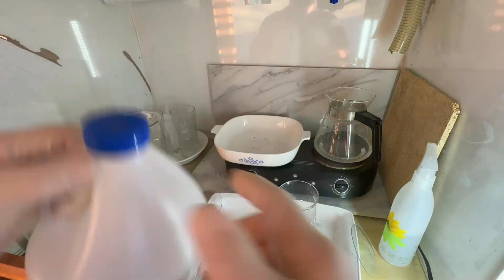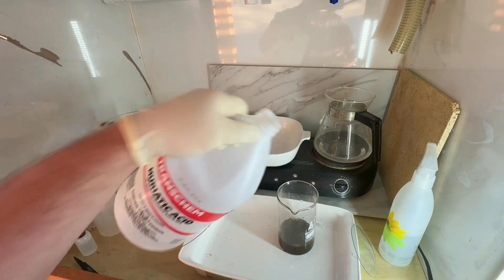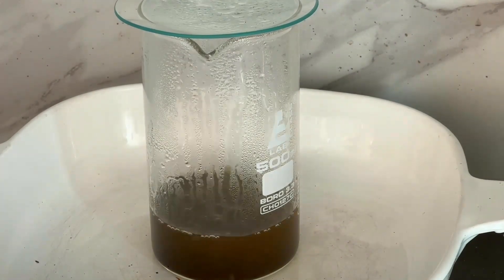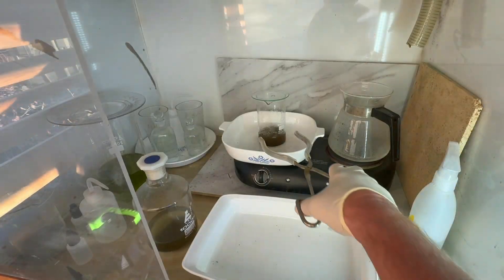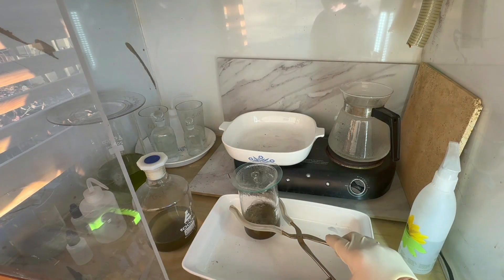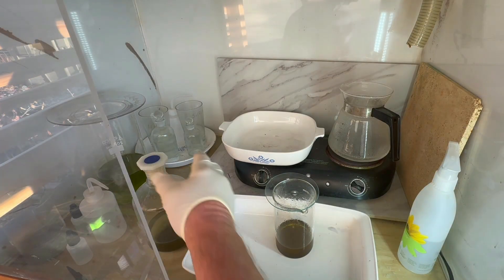The first step is a hydrochloric acid boil so we can get our gold to come together and behave better through the rest of the wash process. We'll pull it down off the heat after boiling for a while, let it cool down a little bit, decant it off, and then begin our washes with boiling water.